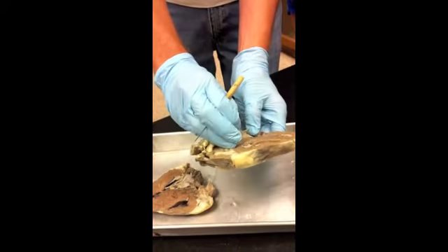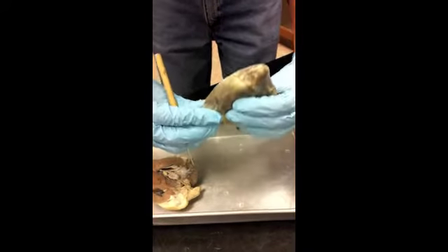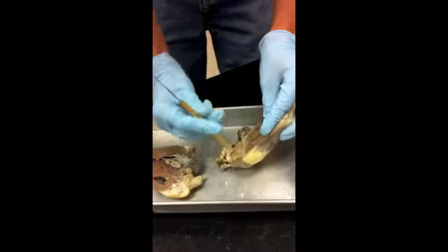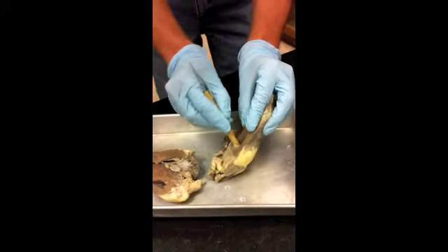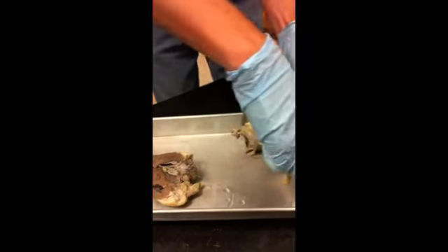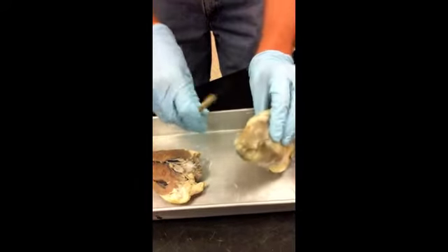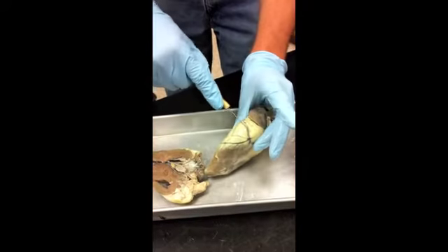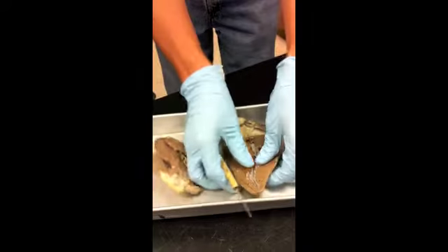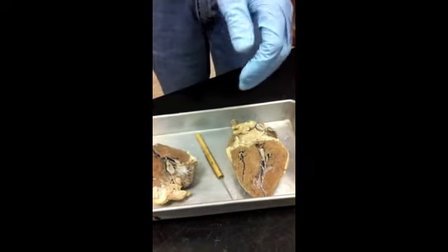No, sorry, the left atrium. And then let's see if we can see that right atrium in here. The right atrium is up in here, but if you get some gloves and do this, you can sort of see up into the right atrium. And all this muscle tissue, you'd call this myocardium. And this is some adipose tissue out here, some fat. And I think that's about it as far as stuff that's going to be good for identifying on the practical.